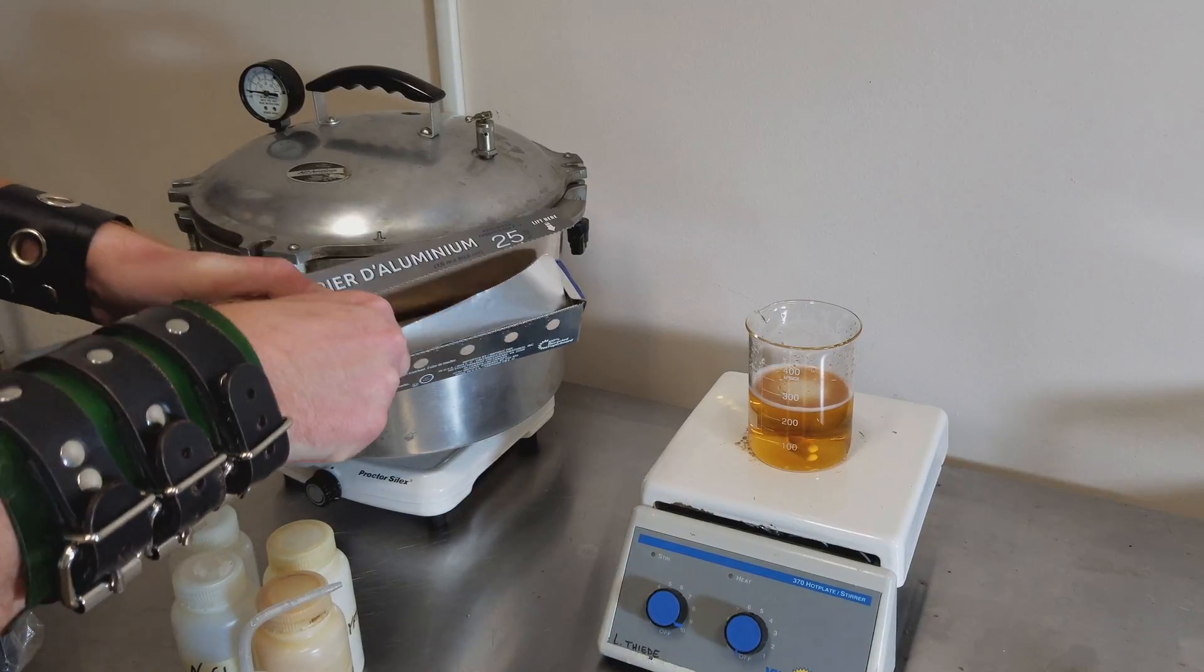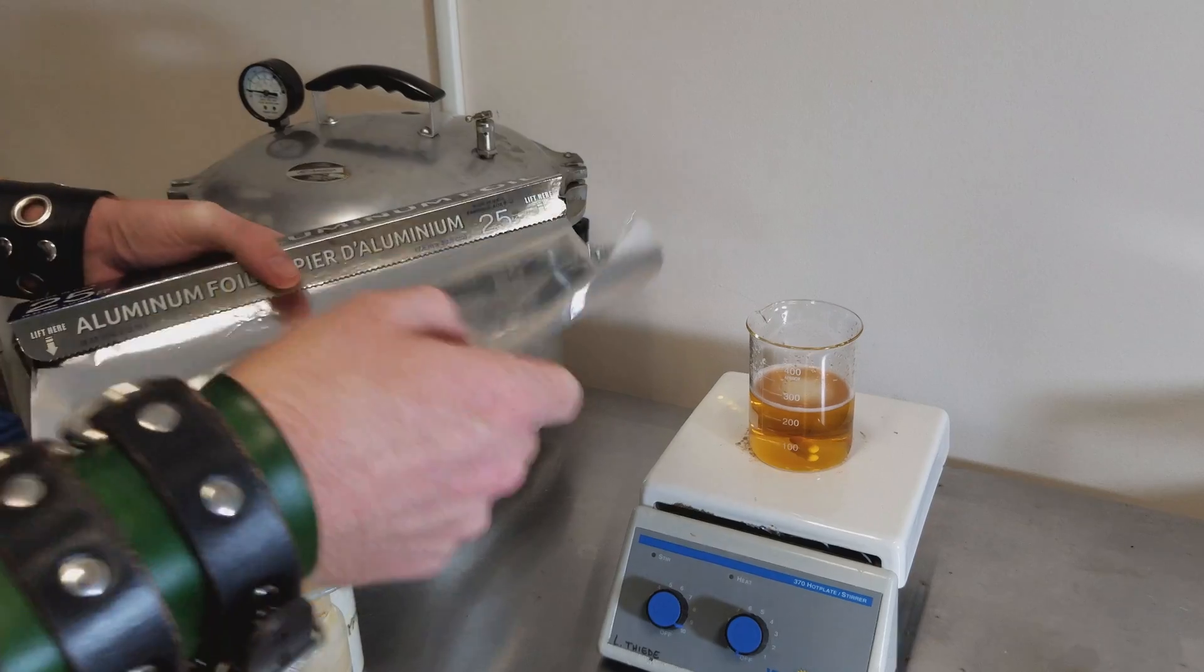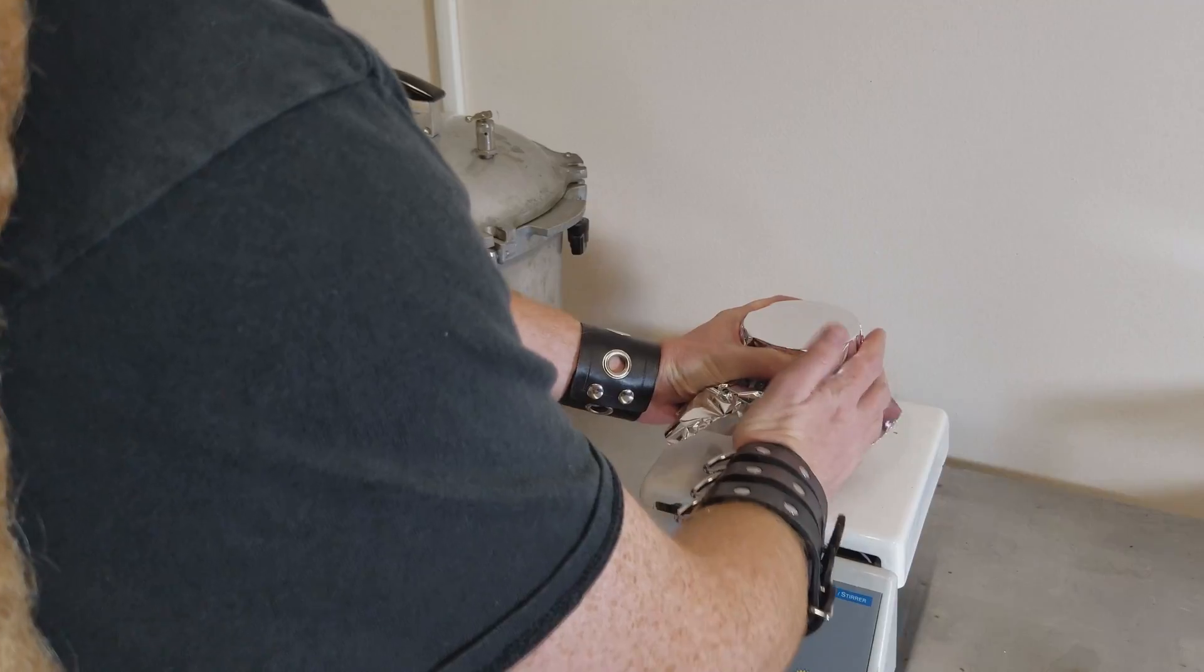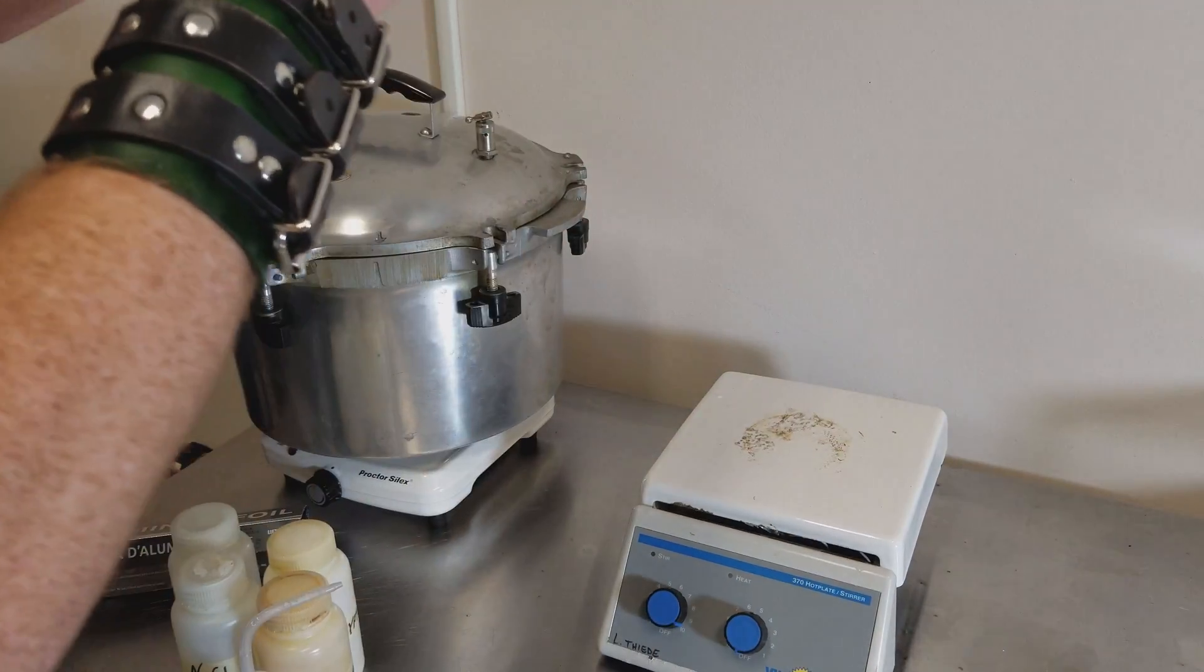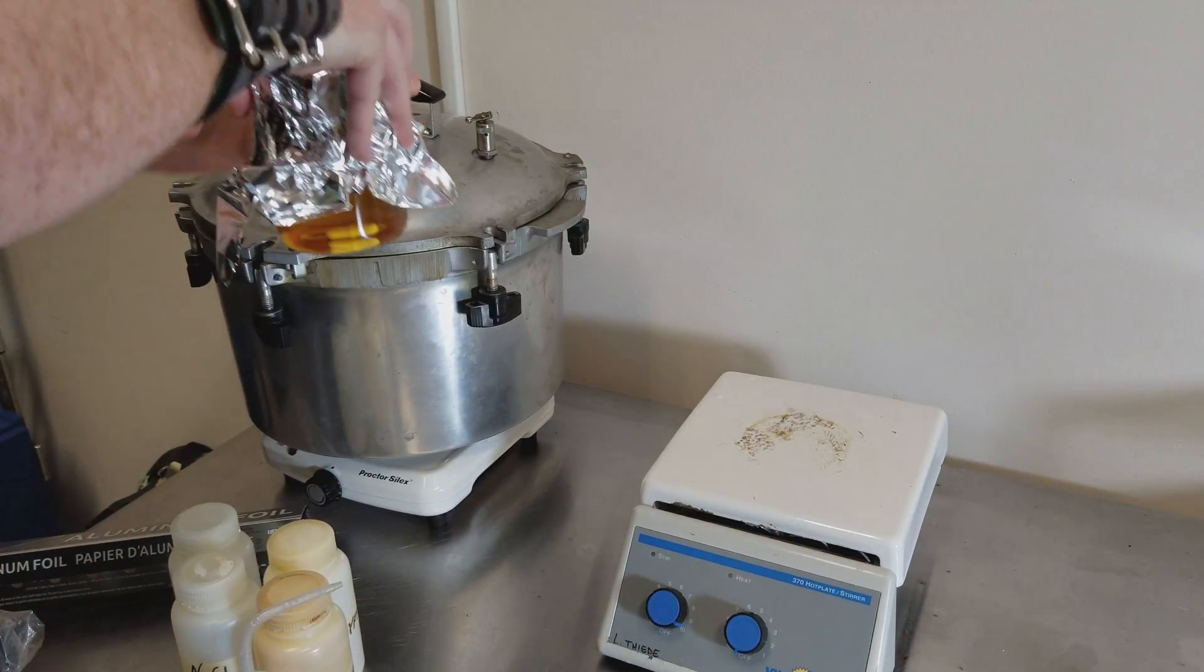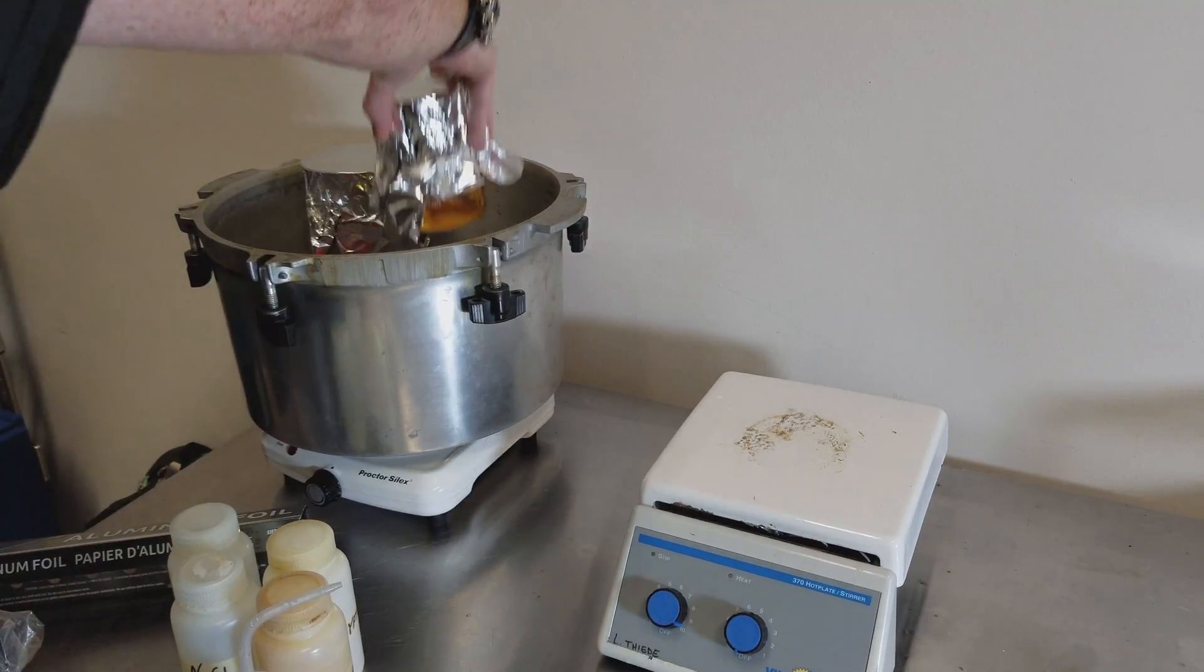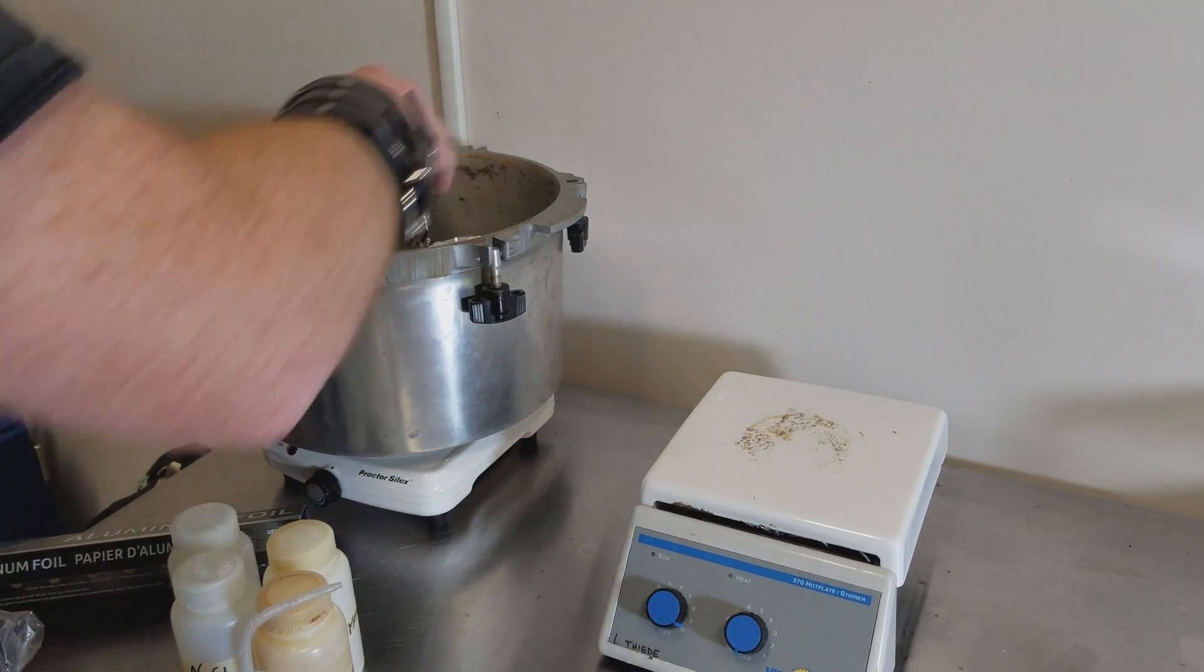Lastly, you'll want to get some tin foil and cover the beaker. You'll want to autoclave the growth medium before using it because you'll grow all kinds of things, not just your K12. Place that in the autoclave and mix whatever else you need.